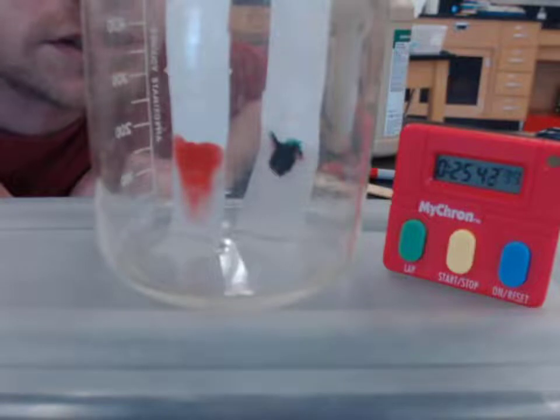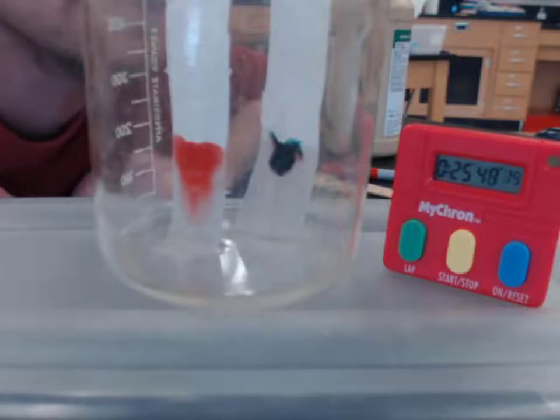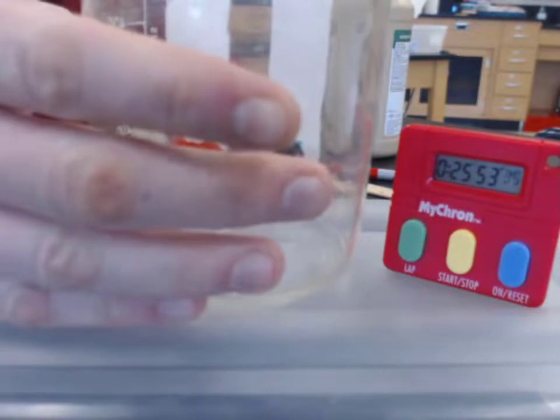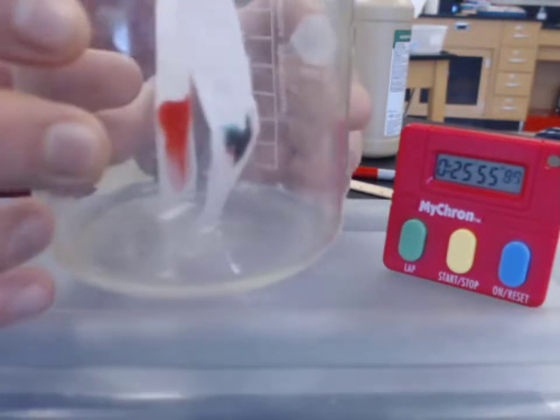Well, our solvent is certainly taking a long time to move its way up the filter paper, but it is moving. It's a lot easier to see differences right up here close in person than it is with the camera, I think, but we'll try to see if we can get a more close-up picture of our black spot. If you can focus, camera. Let's see. You see there are definitely different colors there. The greenish turquoise-ish color is just at the top.